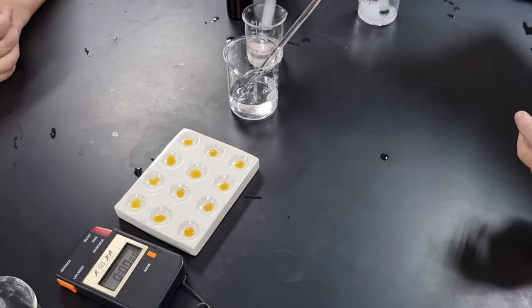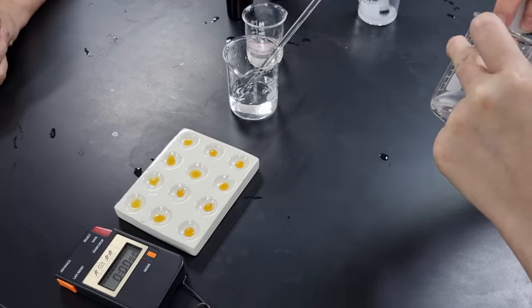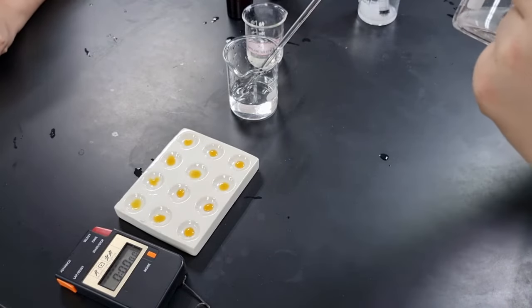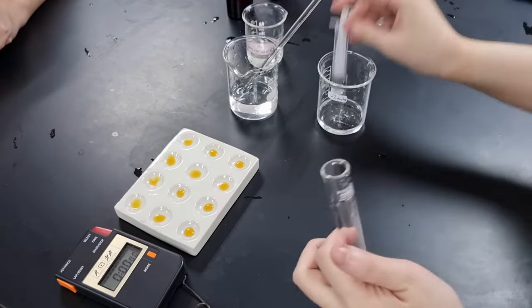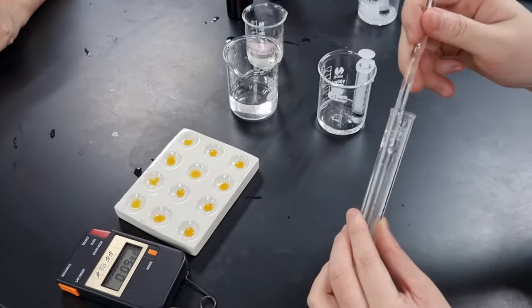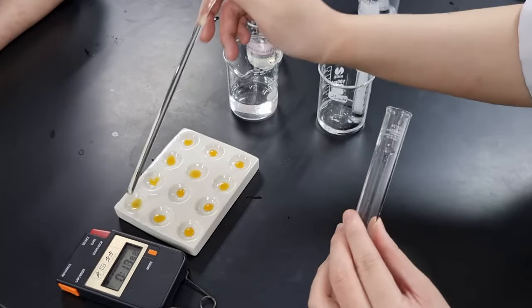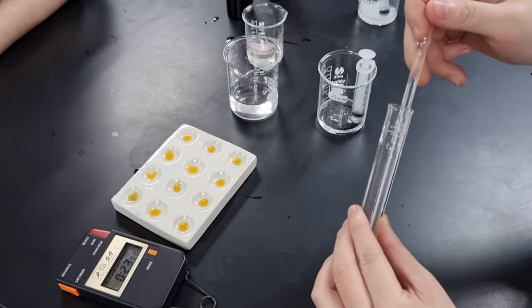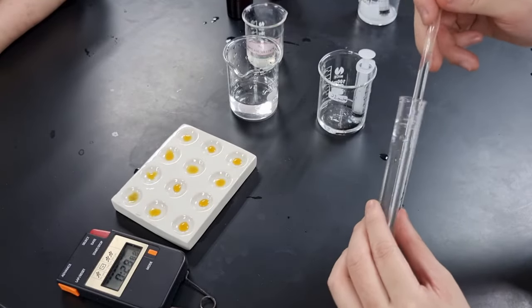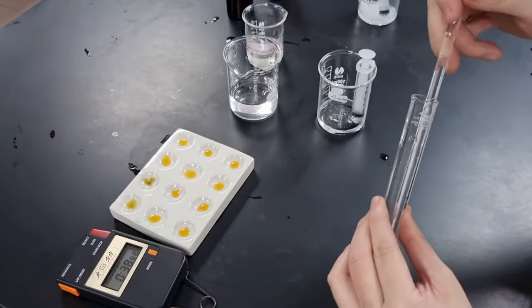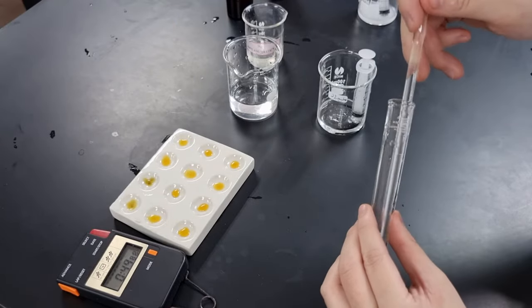Let's take a look at how this is done in real life. I add the two mixtures together into a test tube, and immediately start the timer. I'm using a glass rod to stir, and every 15 seconds I'm going to drop it onto the spotting tile. I'm going to rinse the glass rod quickly in water, which is the beaker that I'm dipping it in there.